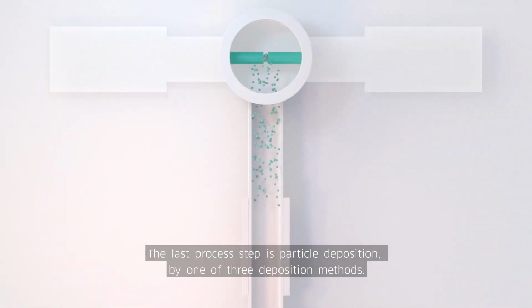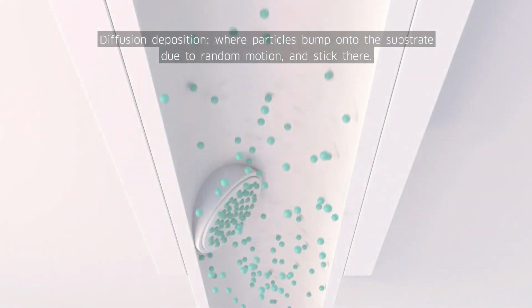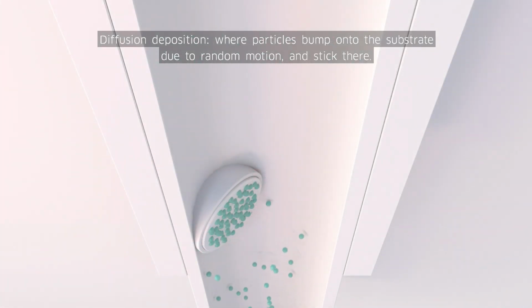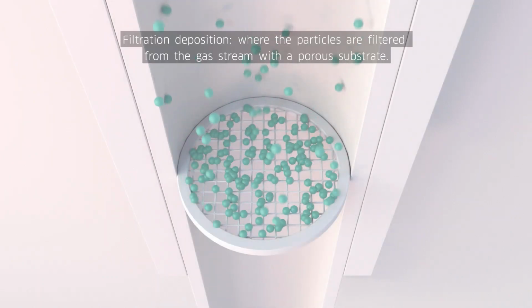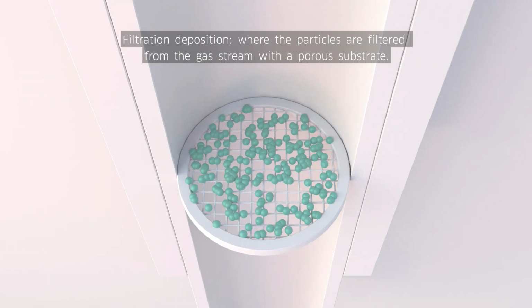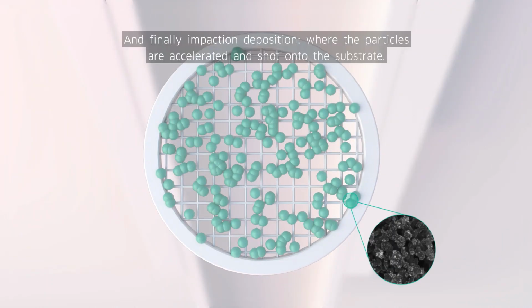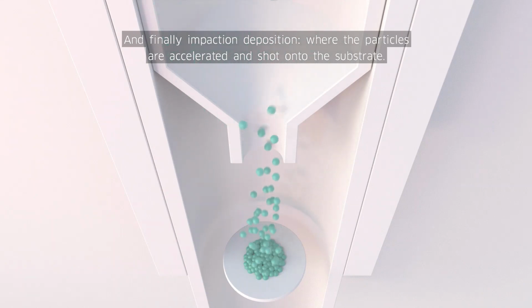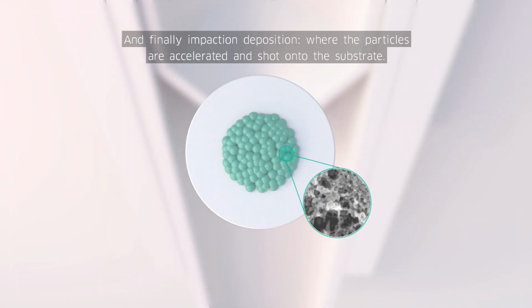The last process step is particle deposition by one of 3 deposition methods. Diffusion deposition, where particles bump onto the substrate due to random motion and stick there. Filtration deposition, where the particles are filtered from the gas stream with a porous substrate. And finally, impaction deposition, in which the particles are accelerated and shot onto the substrate.